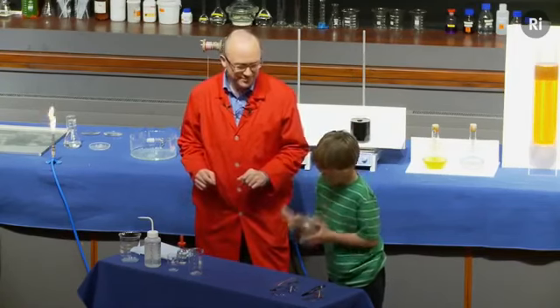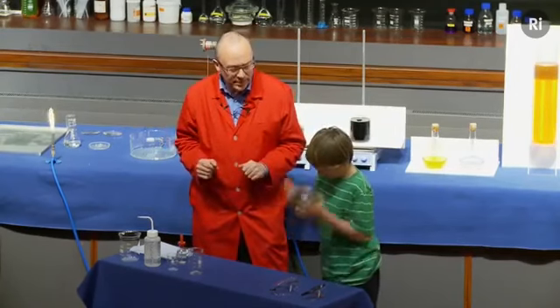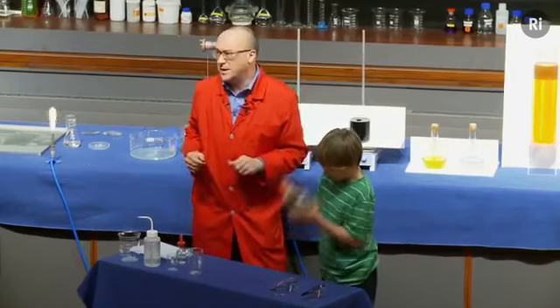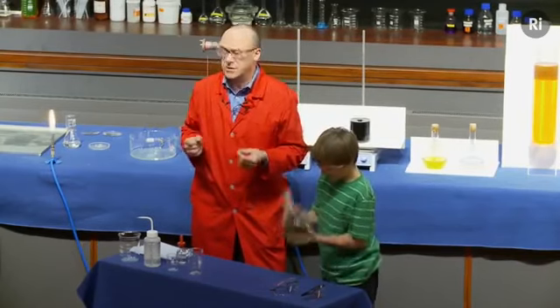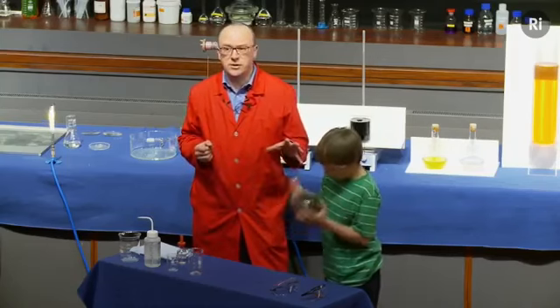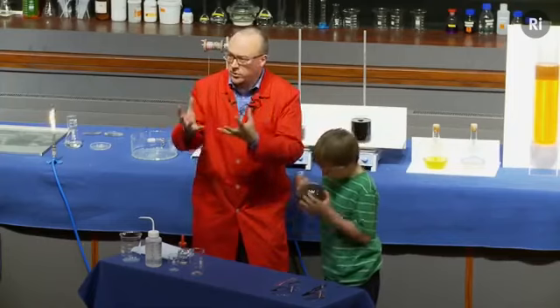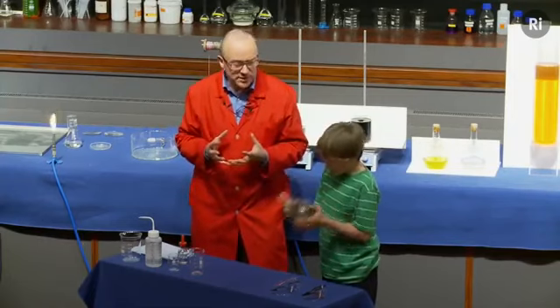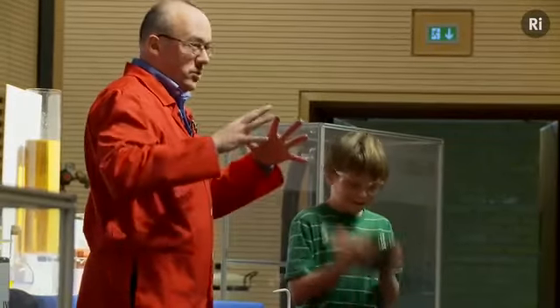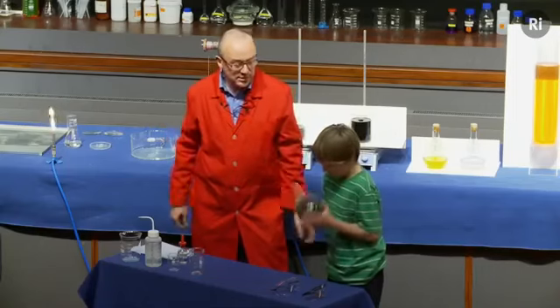Okay. So silver metal is being formed sort of atom by atom, and you can see it's all going quite black. That's because very finely divided silver is actually black in colour. What we're hoping is going to happen over the next minute or so is that those particles of silver will start to stick to the walls of the flask. And as they build up, we should see silver metal in the form of a mirror building up on the inside of the flask.